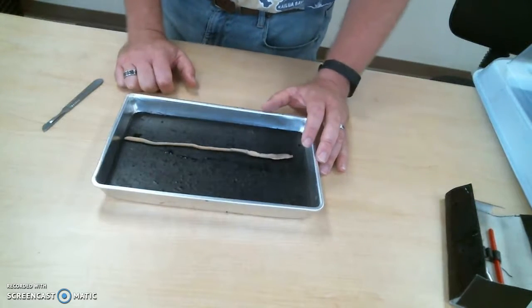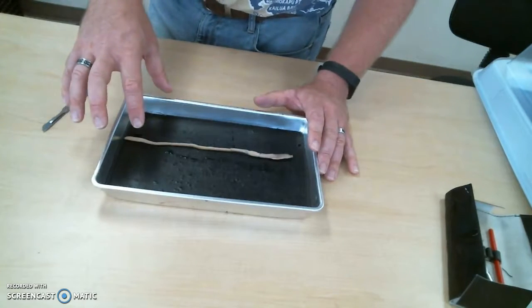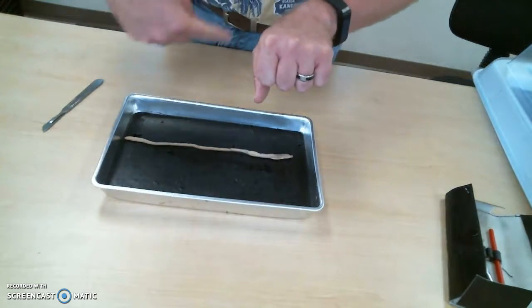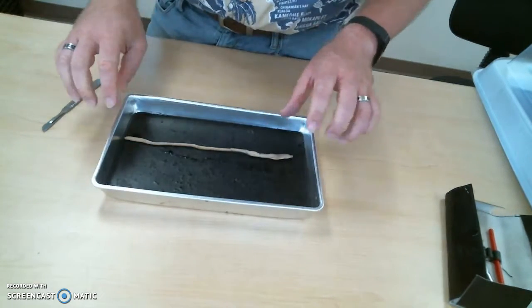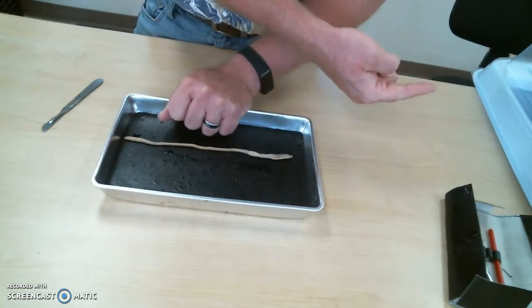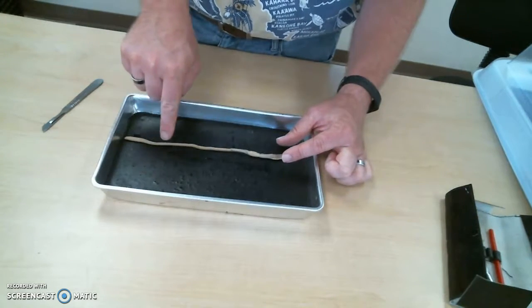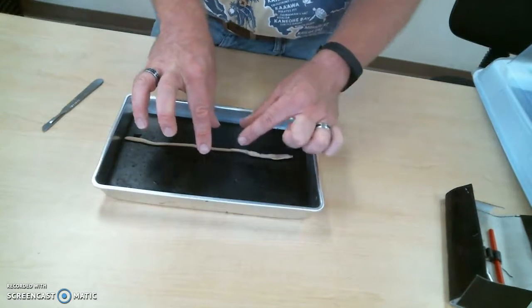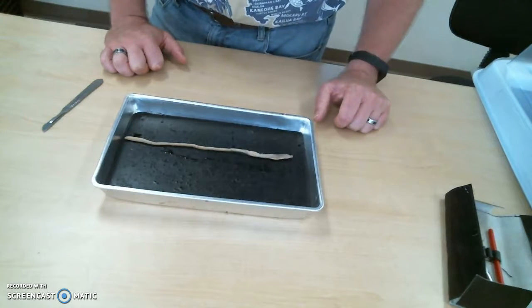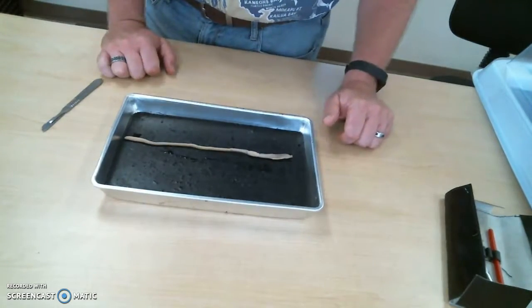Yeah, so he will anchor the hairs in the back end of the animal into the soil, and then he'll squeeze all the transverse muscles through the animal to squirt his head forward into the soil. Then he'll anchor those hairs into the soil, draw up his tail, anchor those in the soil, and push himself forward again. So that's how they move through the soil. Alrighty, I think that does it for external anatomy and orientation on the worm.